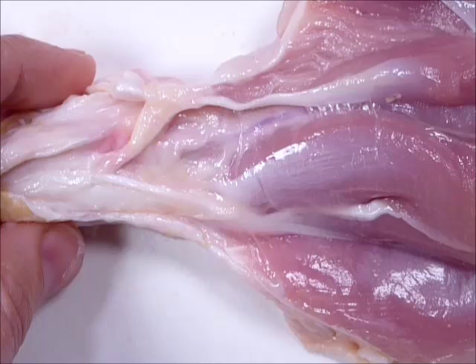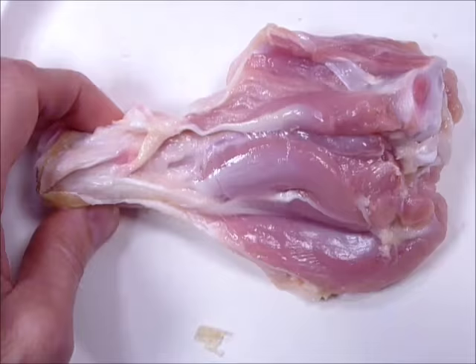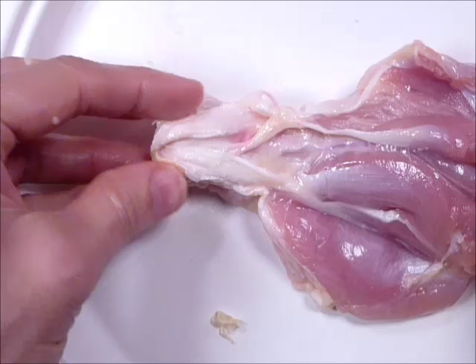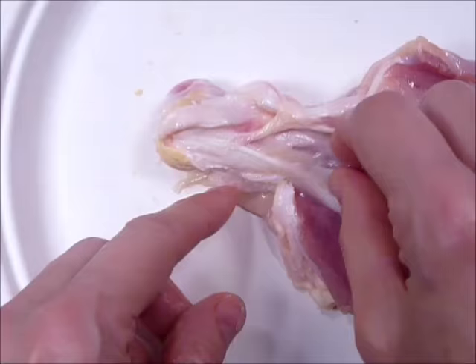It's really important to remember that all the fascia, all these connective tissues, are connected in an entire network. With the foot missing down here, these things would be connected — tendons going all the way down so that when this one is pulling here, it might be pulling the leg down there.